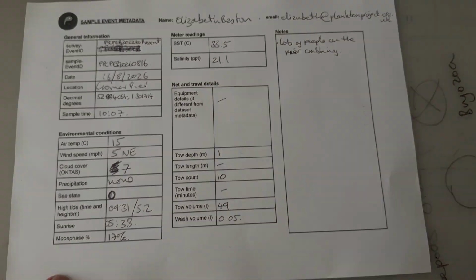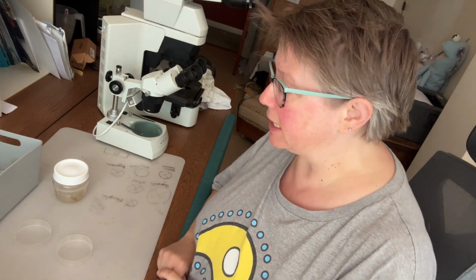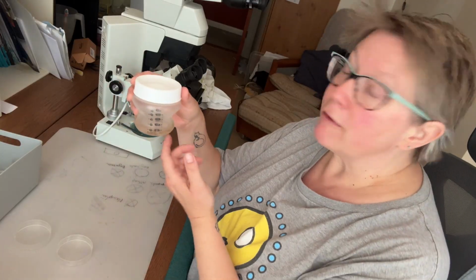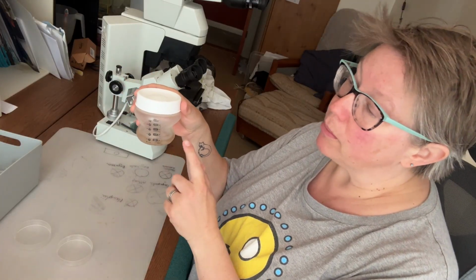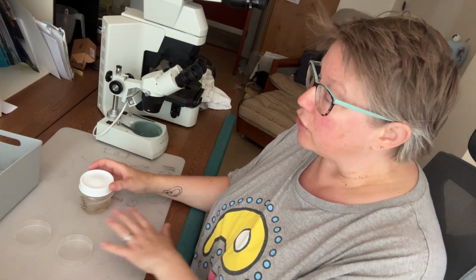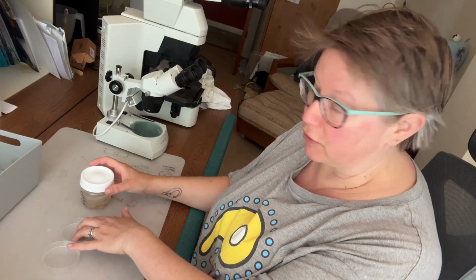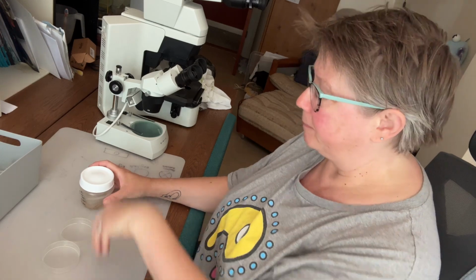The first thing to do when you get your sample home from the survey point is to put it into petri dishes. Now, sometimes that might be one petri dish, it could be several petri dishes. And often, if there's a lot of sediment in your sample, you may want to leave it for a few moments to settle out so that you can then pour non-sedimenty sections of the sample into petri dishes and then have a final petri dish with all of the sludge in it to examine later.